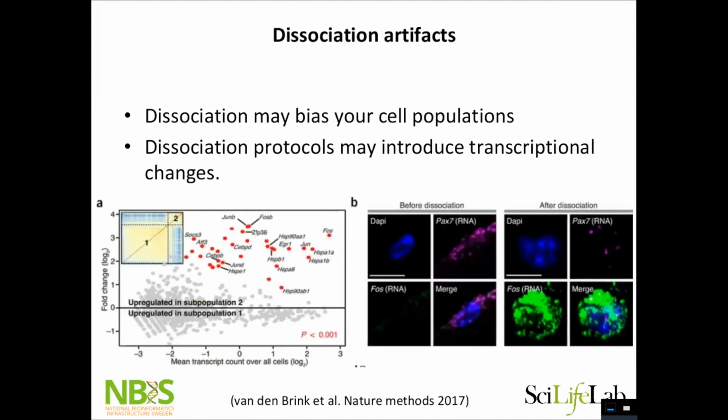There is also a problem that you might get artifacts from the dissociation protocols. This is one study where they showed induction of some genes during dissociation. They basically stained cells before and after dissociation, and you can see that there are a lot of genes that are upregulated. And they show that you can get artificial clusters of cells that are just a dissociation-induced effect. So it's good to keep in mind and check for in your data.